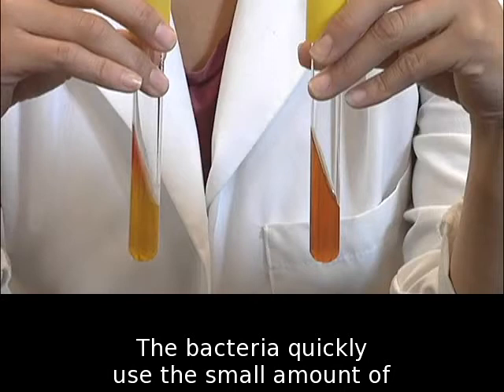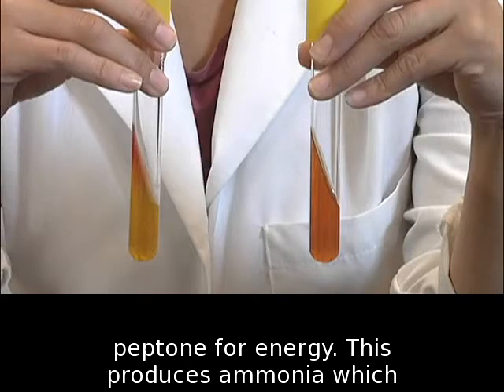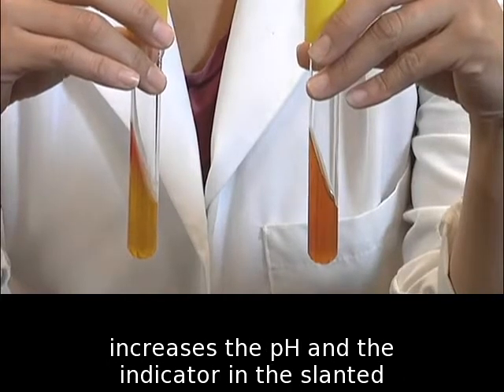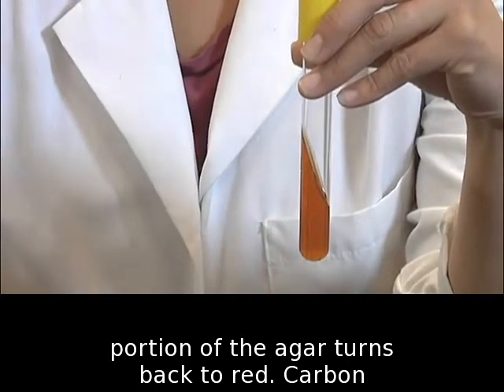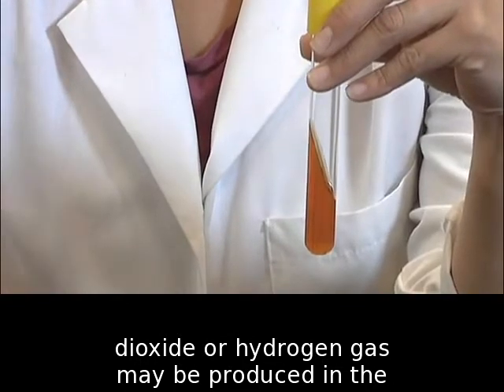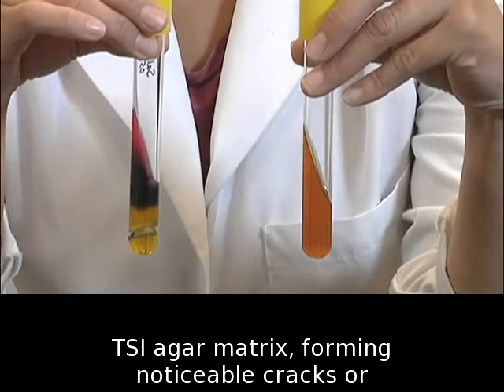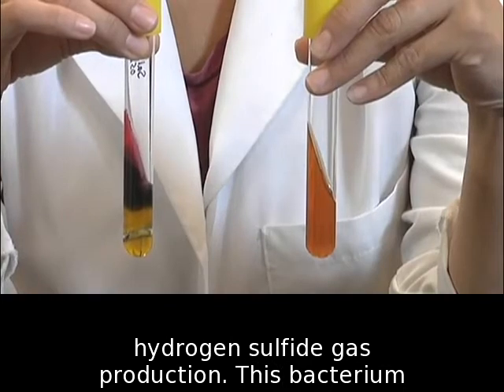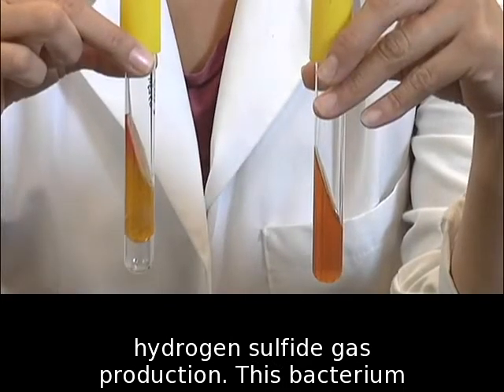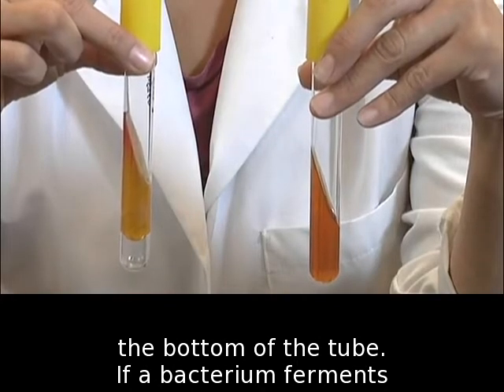The bacteria quickly use the small amount of glucose and start oxidizing amino acids in the peptone for energy. This produces ammonia, which increases the pH, and the indicator in the slanted portion of the agar turns back to red. Carbon dioxide, or hydrogen gas, may be produced in the TSI agar matrix, forming noticeable cracks or fissures in the tube. This may be in addition to hydrogen sulfide gas production. This bacterium produced excess gas, causing the agar to lift from the bottom of the tube.